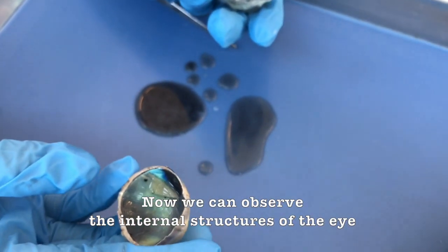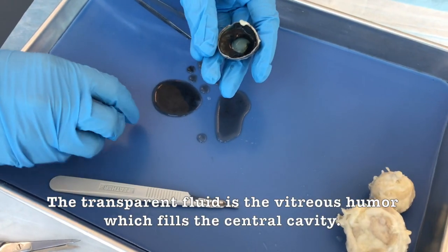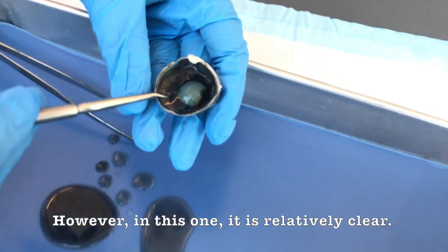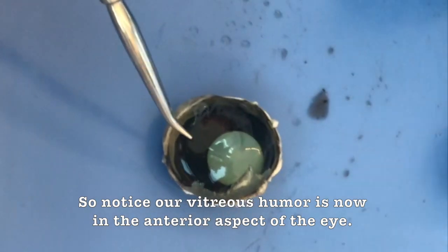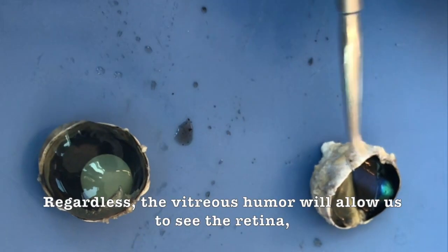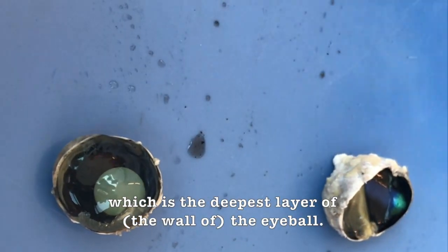Now we can observe the internal structures of the eye and better appreciate its internal compartments. The transparent fluid is the vitreous humor, which fills the central cavity. It might appear cloudy in your specimen. However, in this one, it is relatively clear. So notice our vitreous humor is now in the anterior aspect of the eye. Sometimes it will appear in the posterior aspect, but regardless, the vitreous humor will allow us to see the retina, which is in the deepest layer of the eyeball.